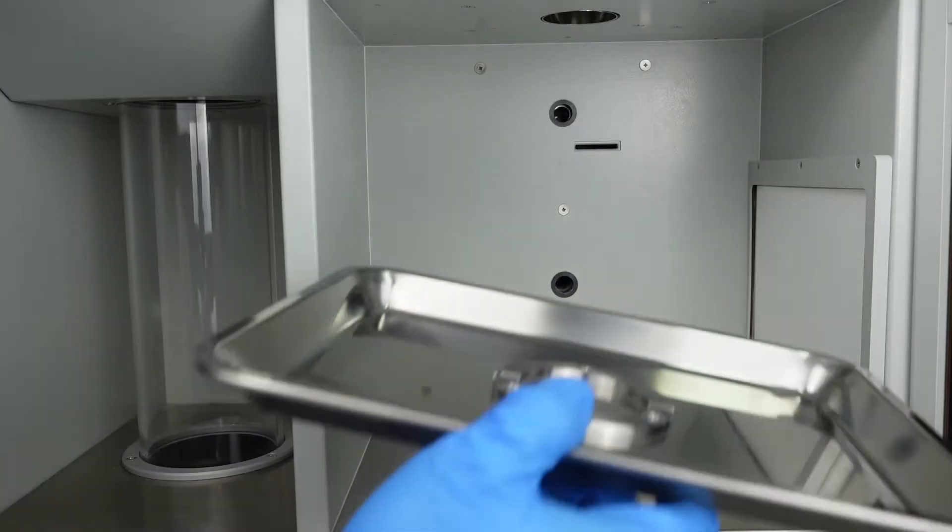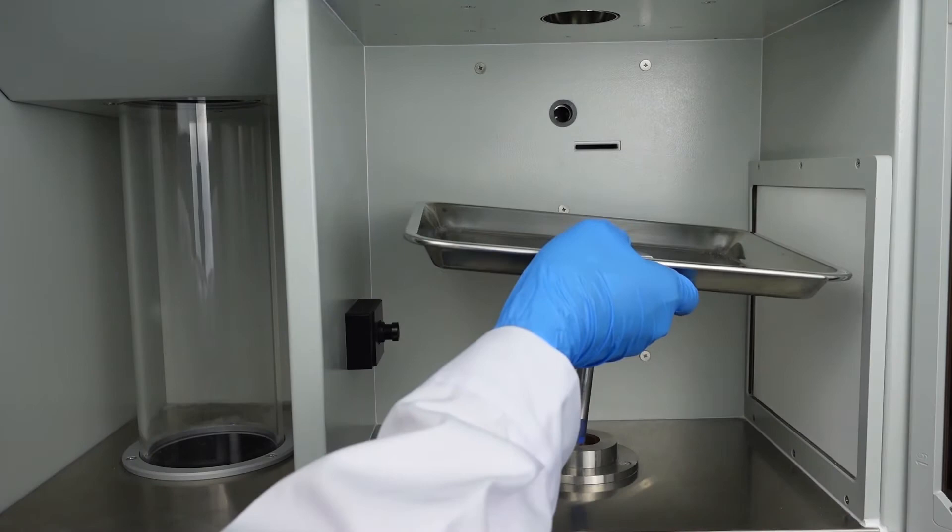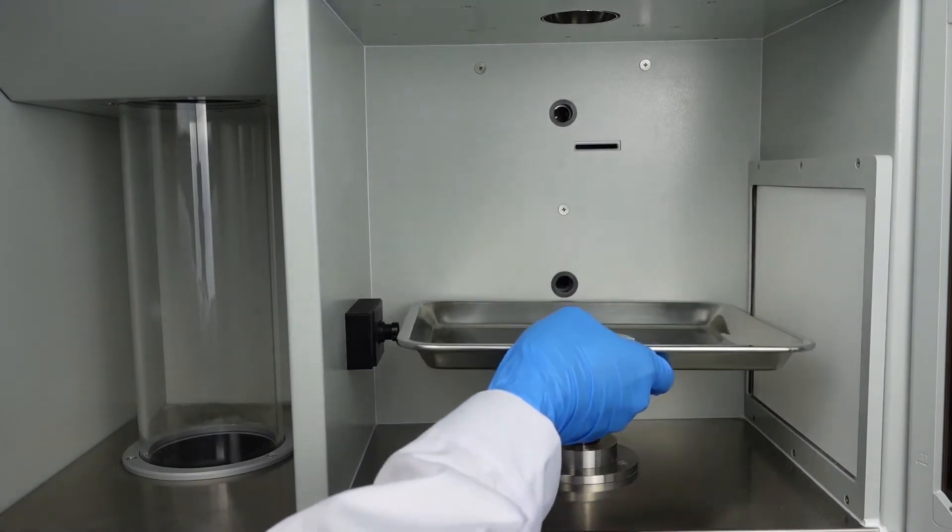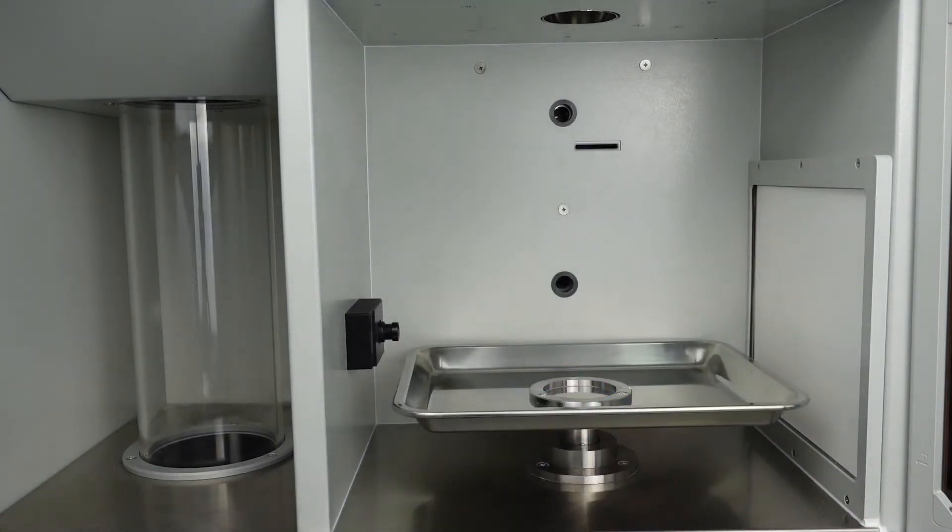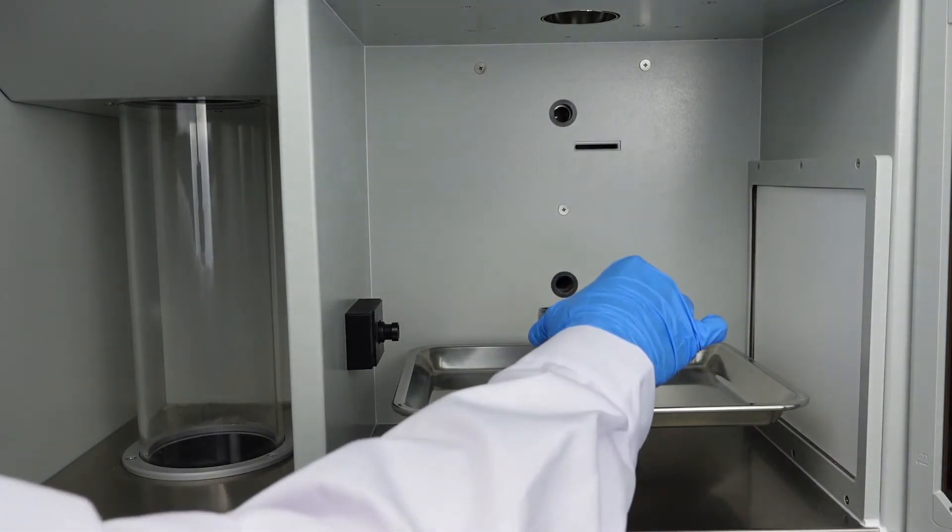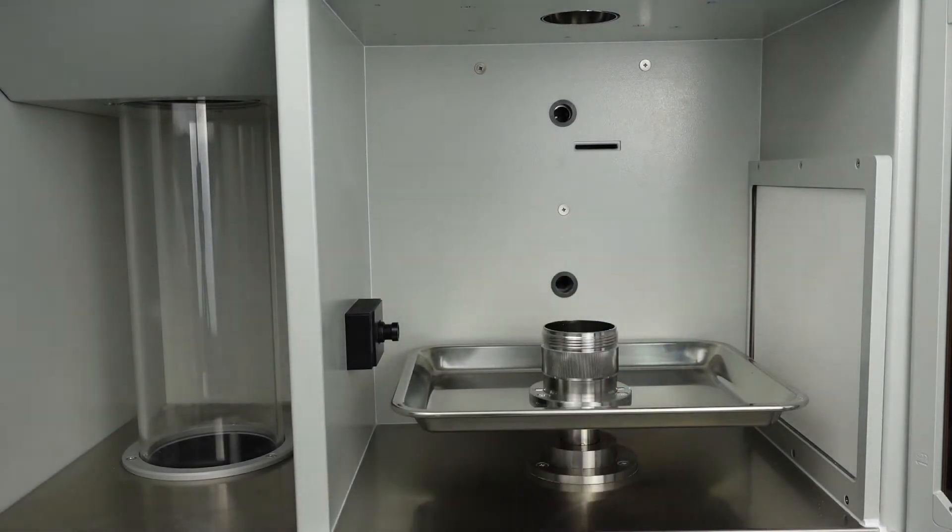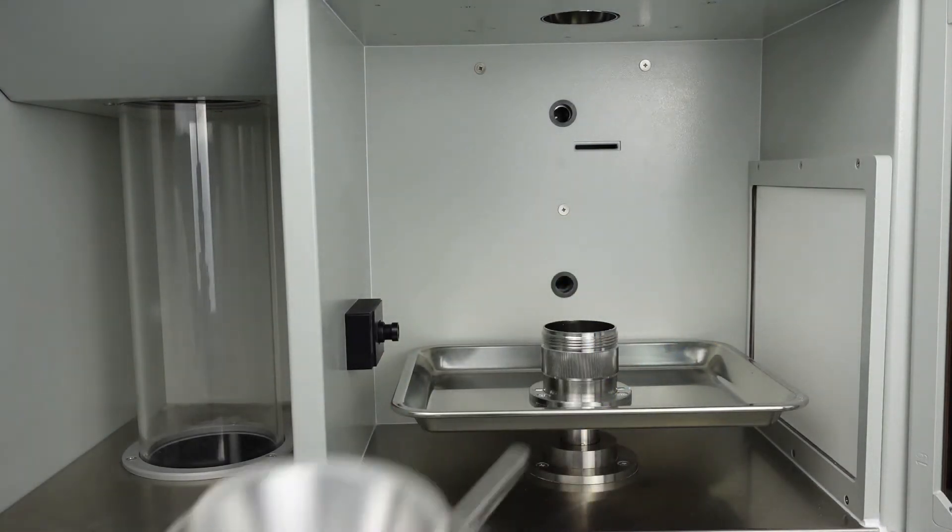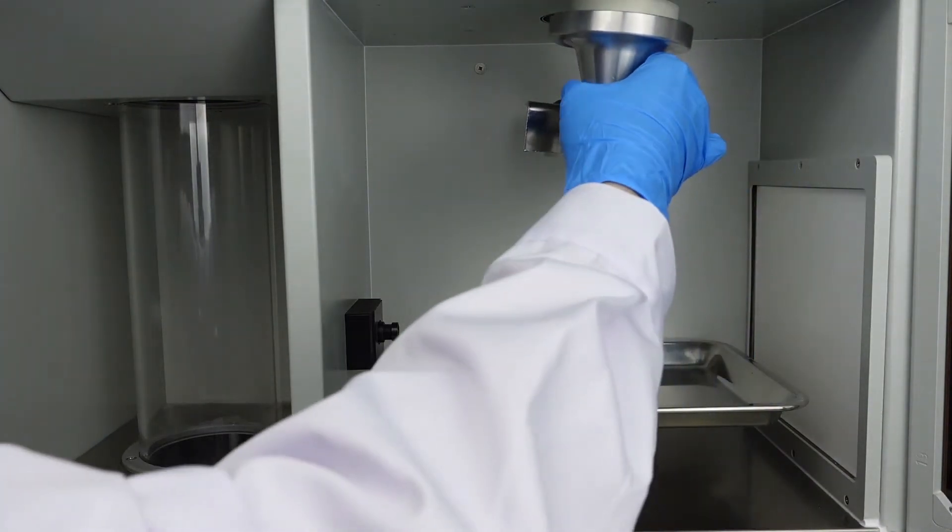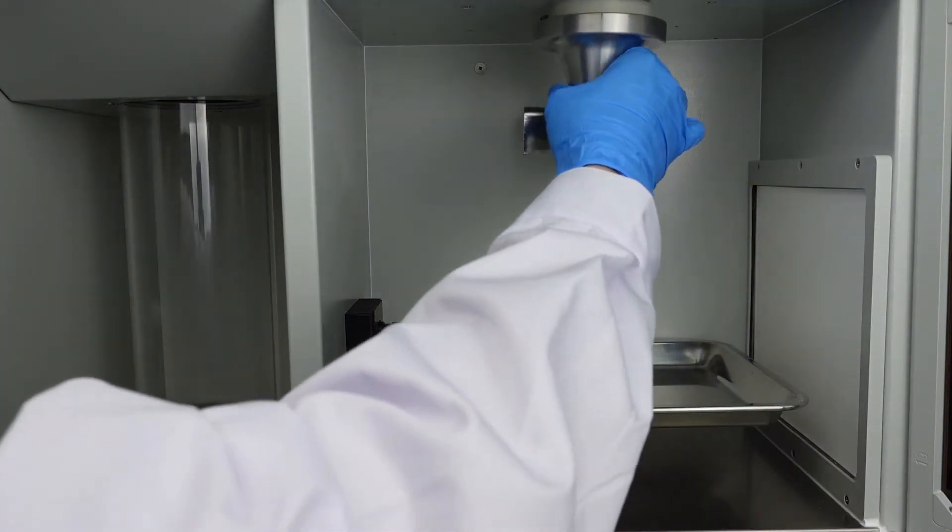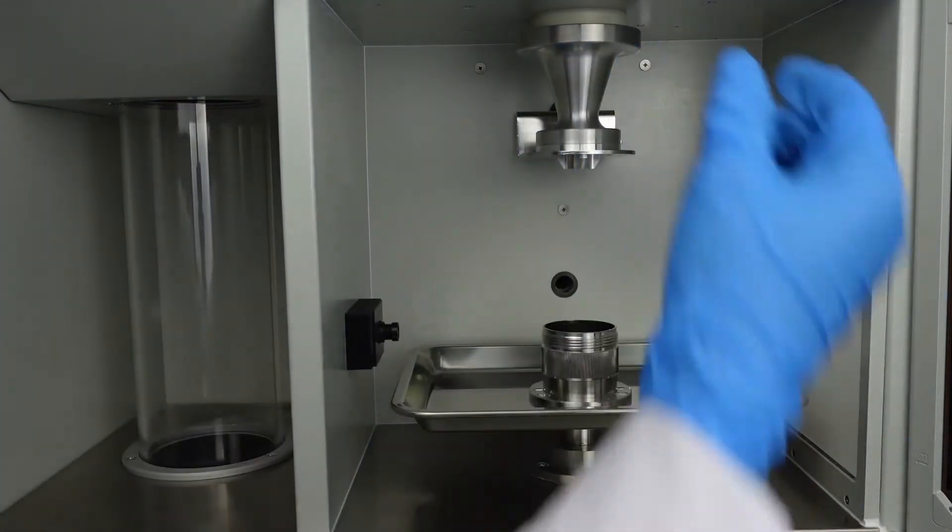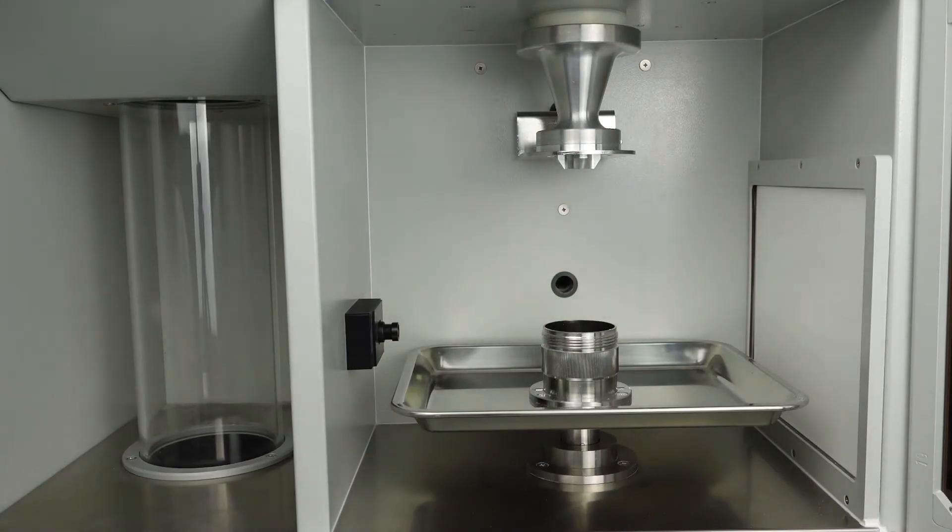Install Stock Pan. Install Density Container C10. Install Feed Assembly C13 with Funnel Clip C12 on.